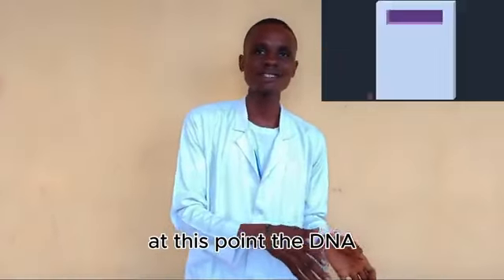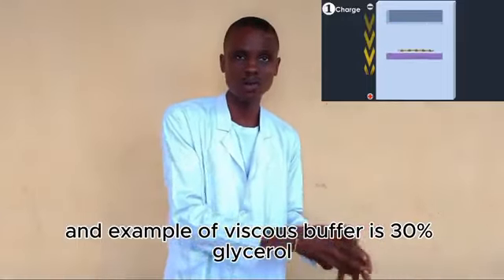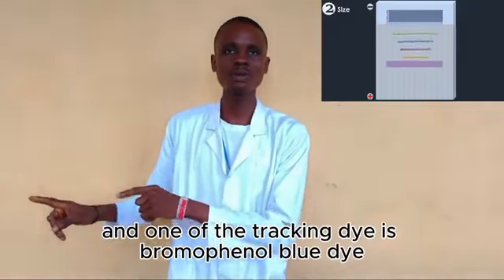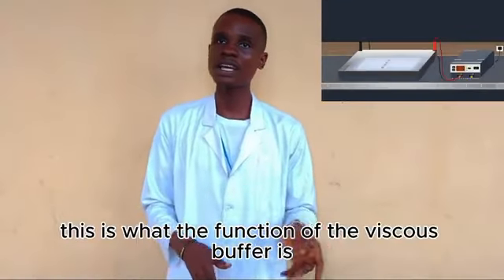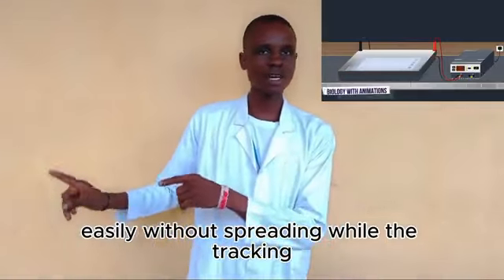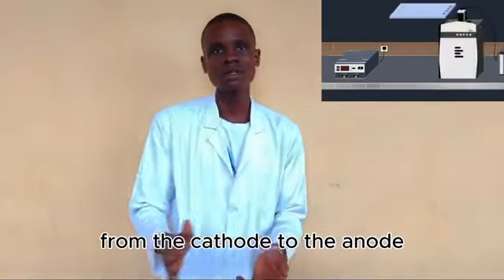At this point, the DNA sample to be resolved is prepared with a mixture of a viscous buffer, an example of which is 30% glycerol, and also a tracking dye. One of the tracking dyes used is bromophenol blue. The function of the viscous buffer is to help the DNA sample penetrate into the wells created by the comb easily without spreading, while the tracking dye helps to monitor the migration of the DNA samples from the cathode to the anode.